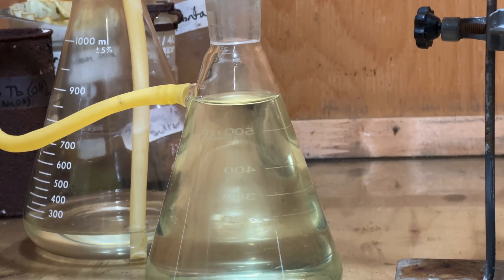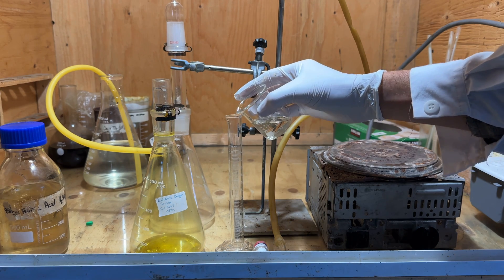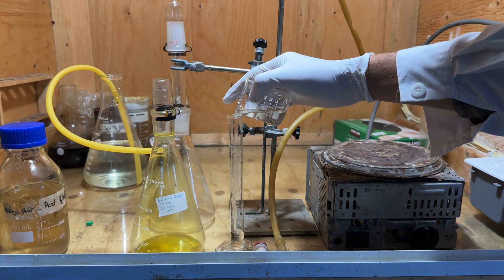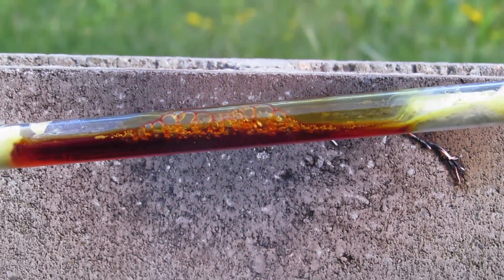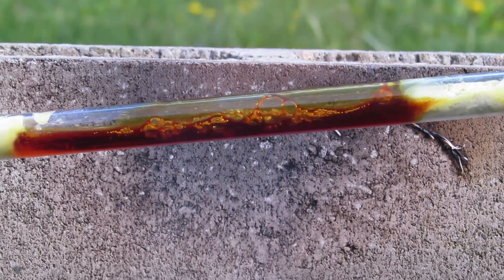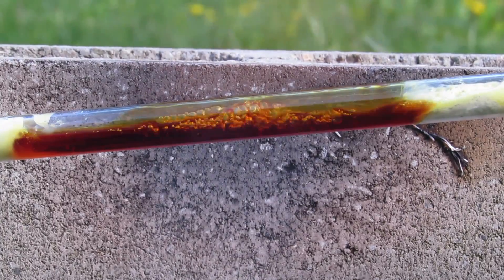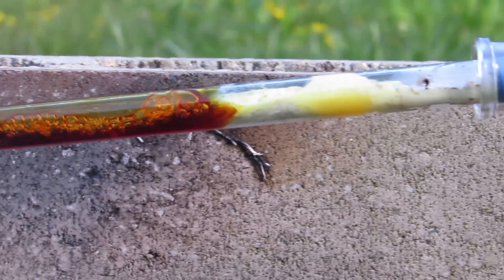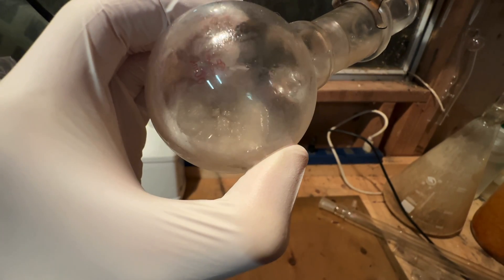If this synthesis was re-attempted, I think using an exact stoichiometric amount of sulfuric acid would be better to reduce sulfuric acid contamination in the final product. In the future, I am going to continue working on producing sulfur trioxide through the decomposition of other sulfate salts to find a safer, easier lab scale route to sulfur trioxide synthesis, so keep an eye out for those projects. I hope you guys enjoyed, and I'll see you in a future video.